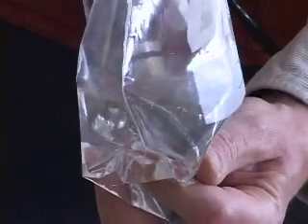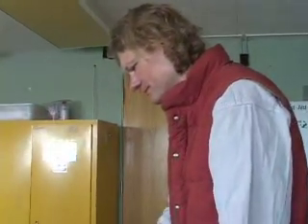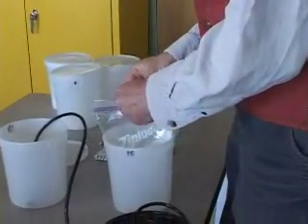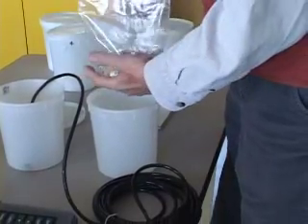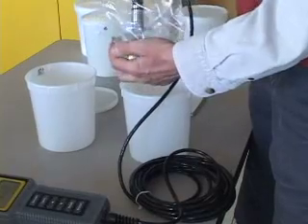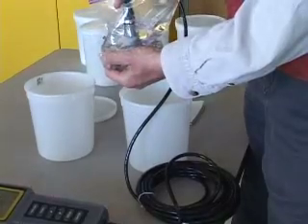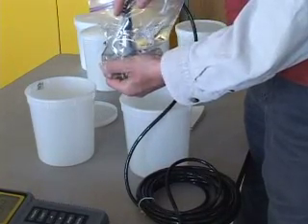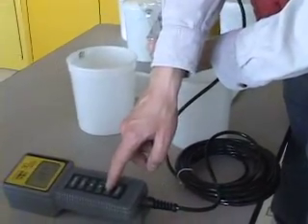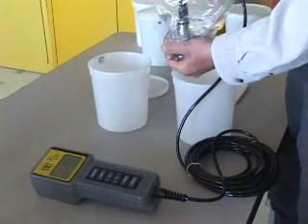Then you wait until the reading stabilizes. So we'll just do one measurement as I would do it. So that's the conductivity here: 6.84 millisiemens.